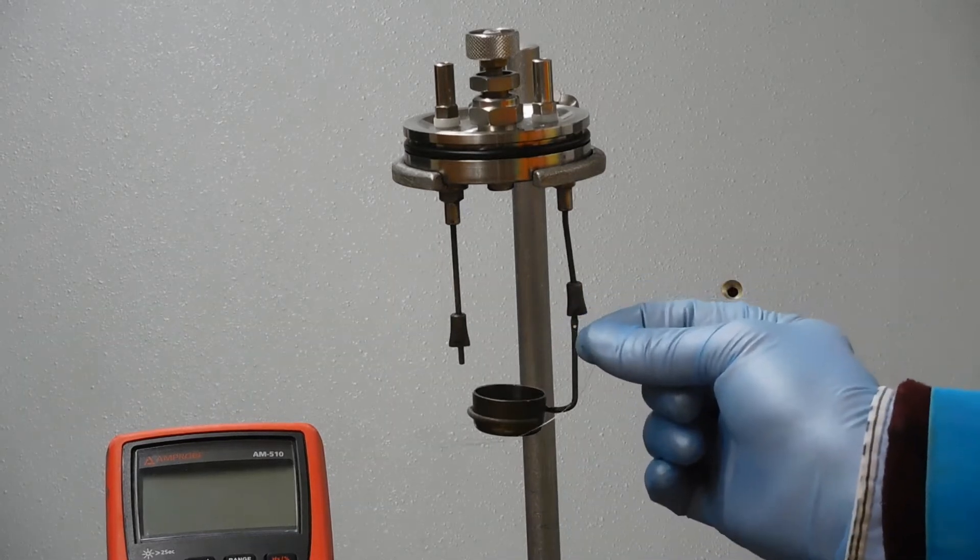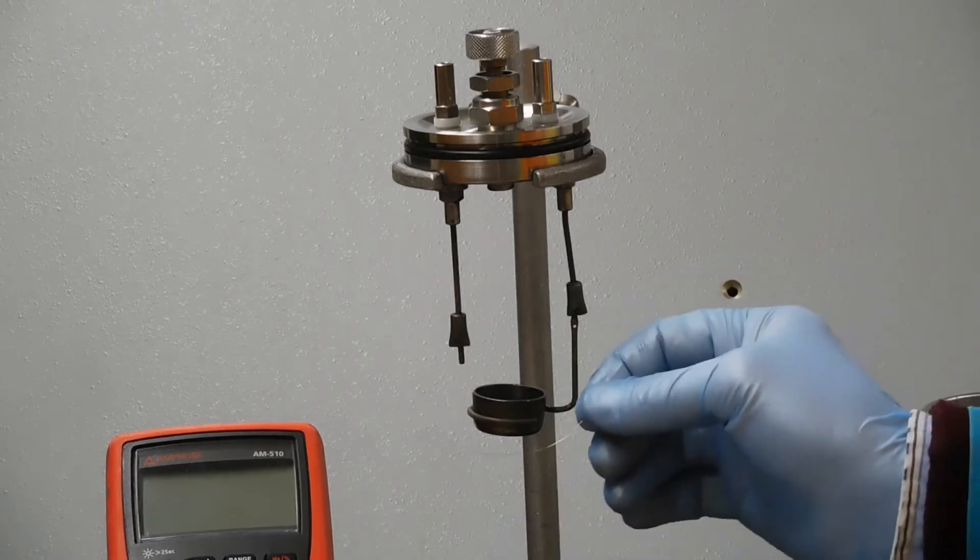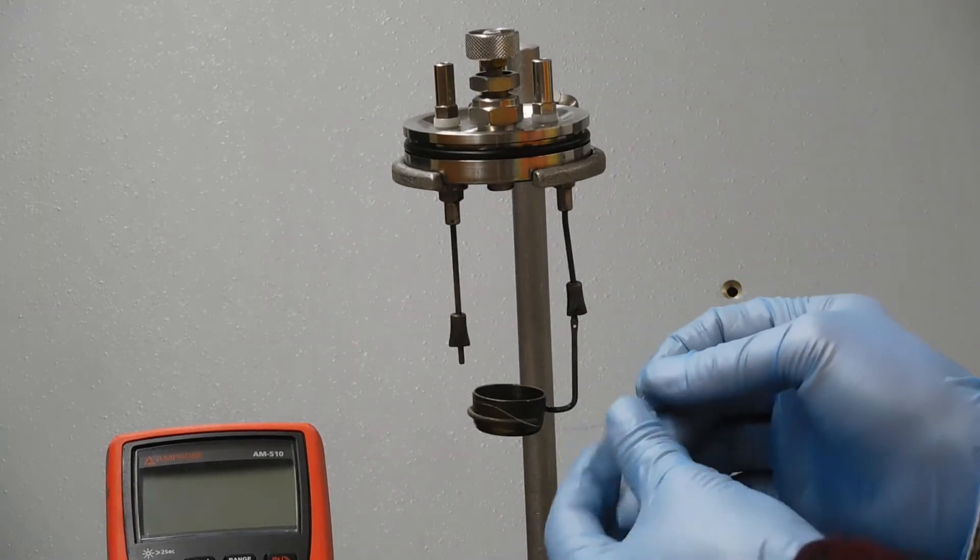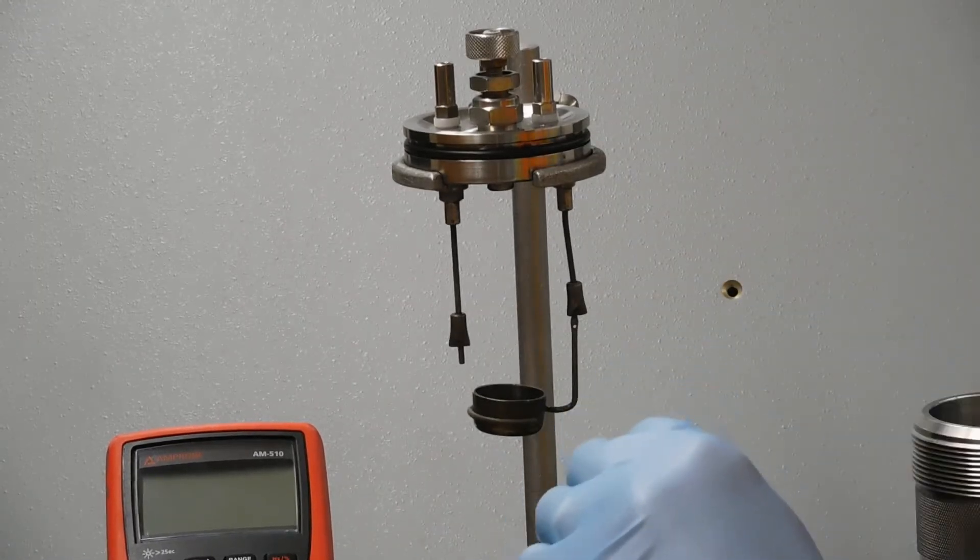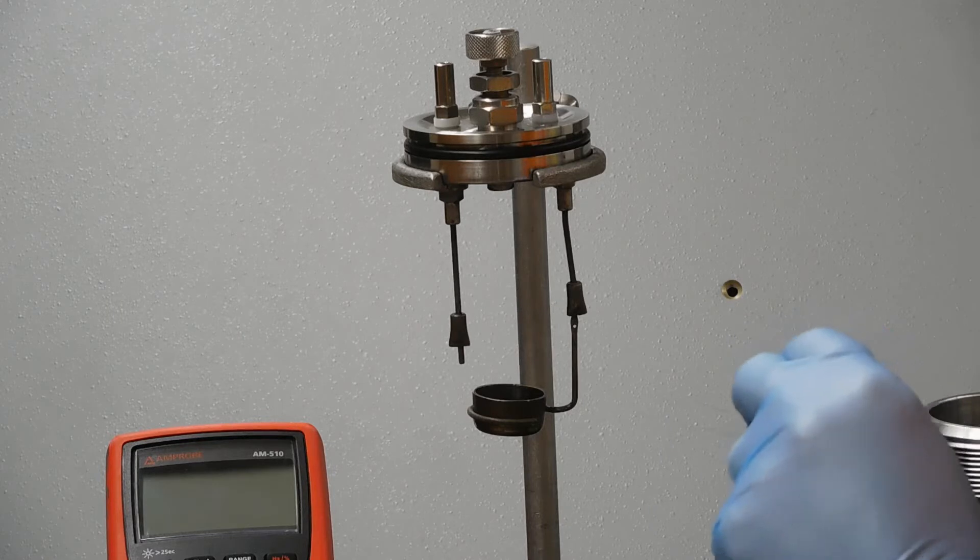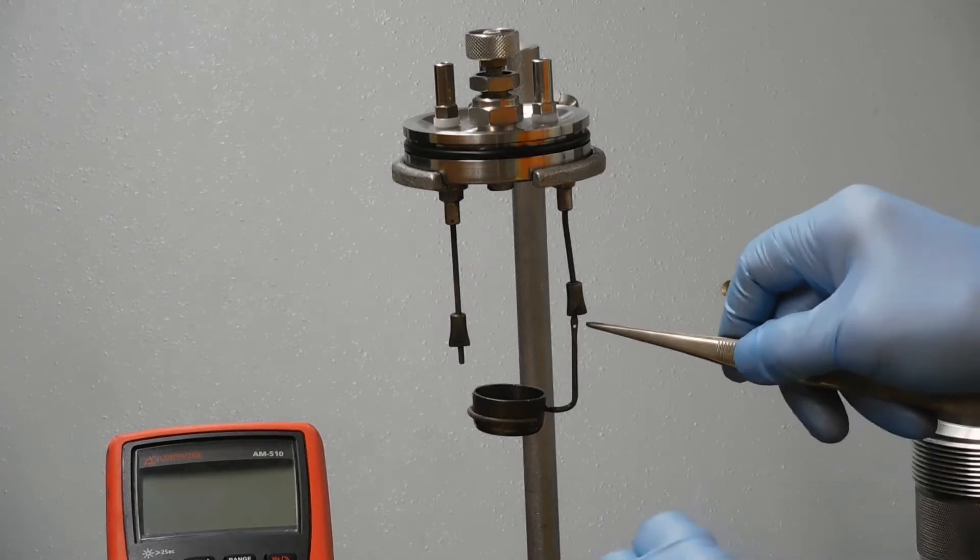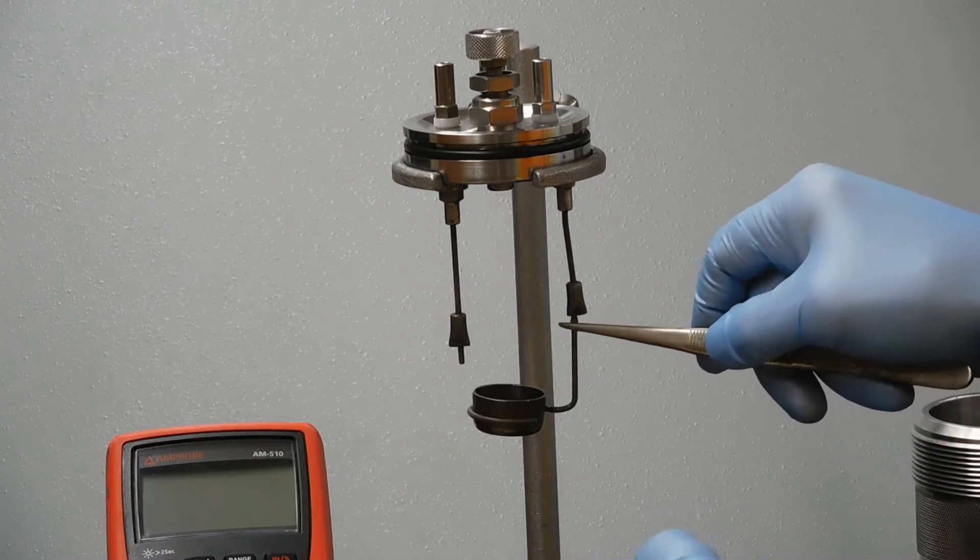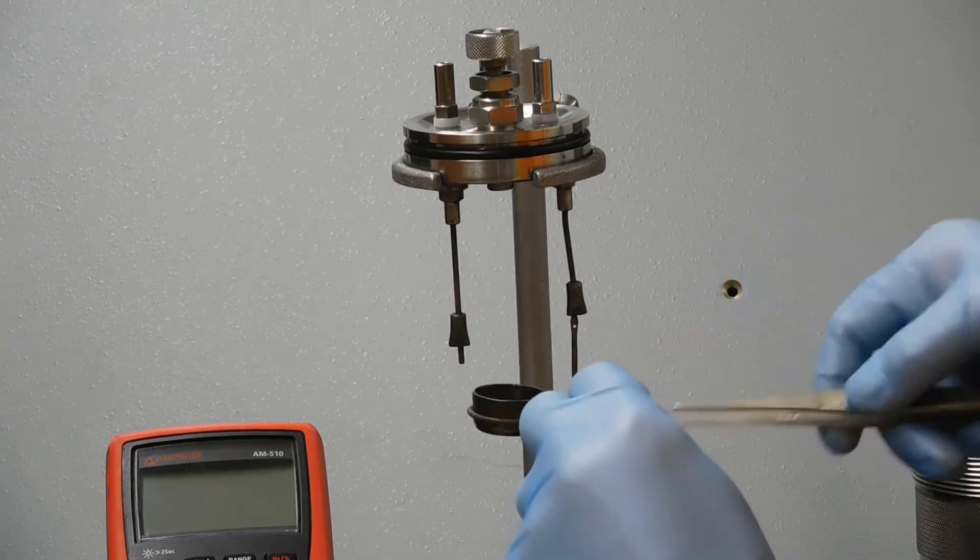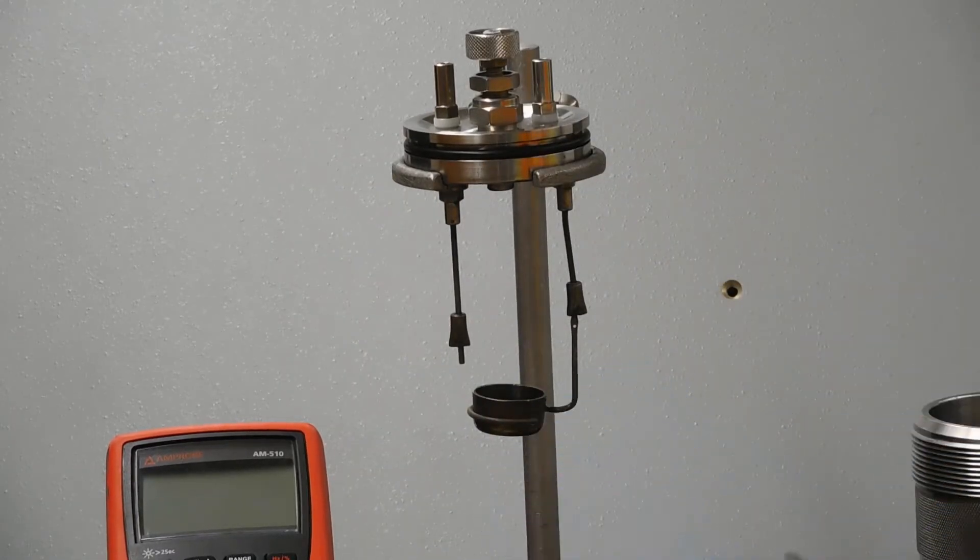This is a little piece of the wire. I'm handling it with gloves, which isn't a bad idea. You could also just handle it with forceps, and actually usually for doing the wrapping, that's exactly what I do. It's important that you wrap these right. It has to go through the hole here and come back out, and that's going to go underneath the main lead going down to the pellet.